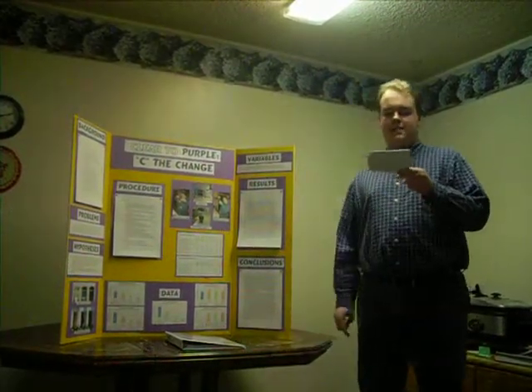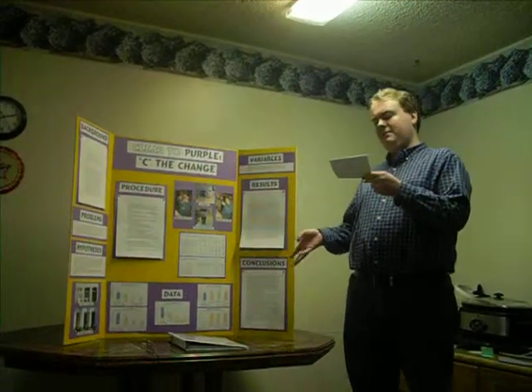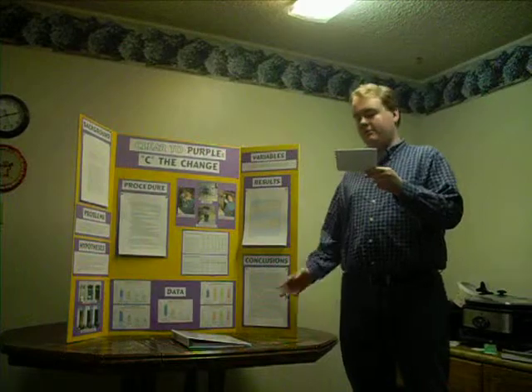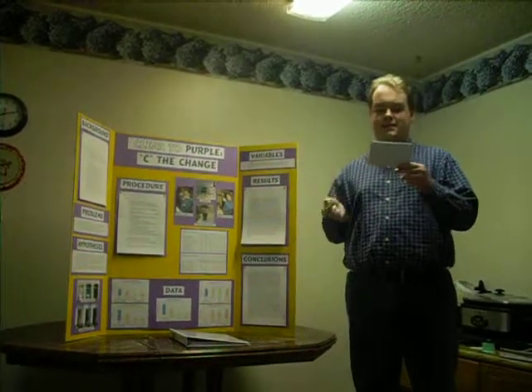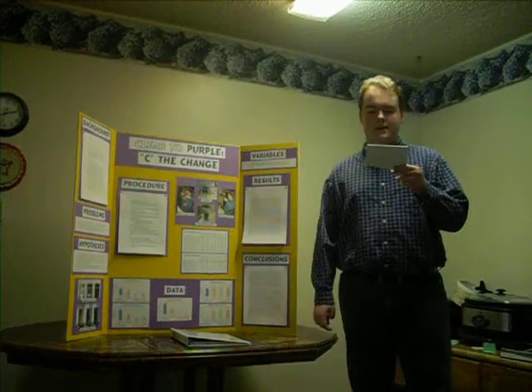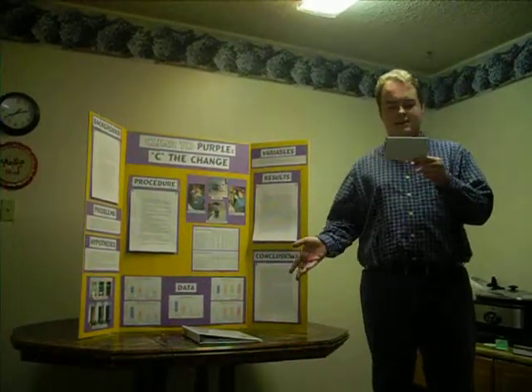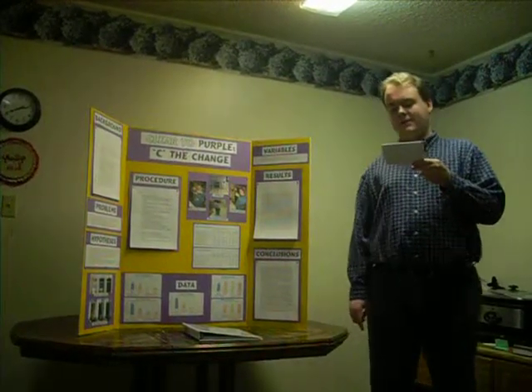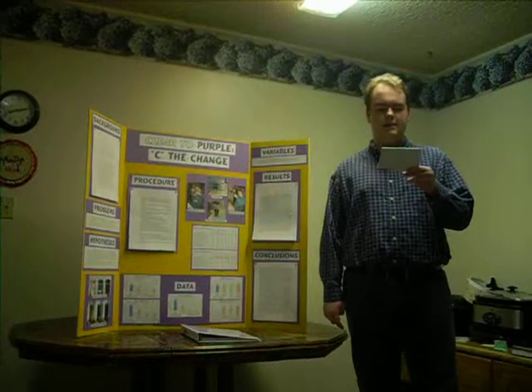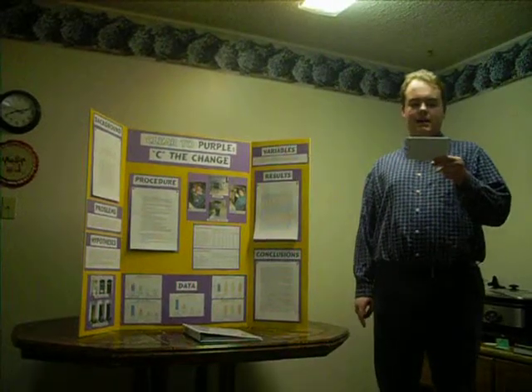For the hydrogen peroxide averages, the 0 milliliter trials didn't work at all within 20 minutes, which was the max time we set for it. The 15 milliliter ones, which is the base experiment, was 546 seconds, like I said earlier. For the 30 milliliters, it was 234 seconds, and for 45 milliliters, 175 seconds. Again, it showed a downward trend, though perhaps not as pronounced as the temperature averages.